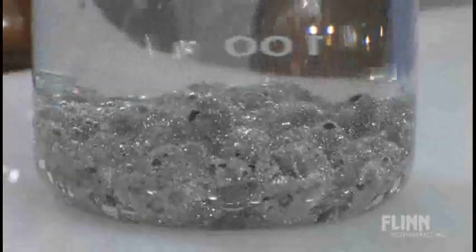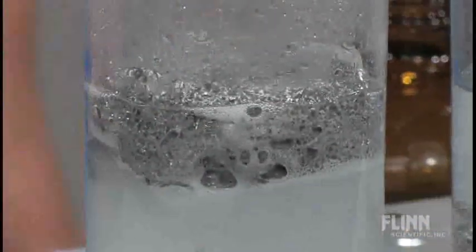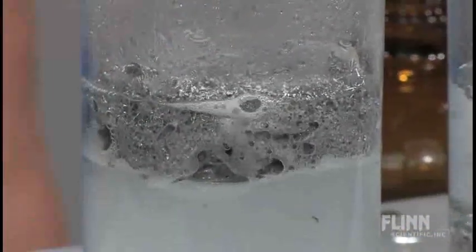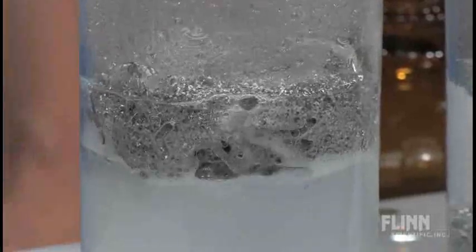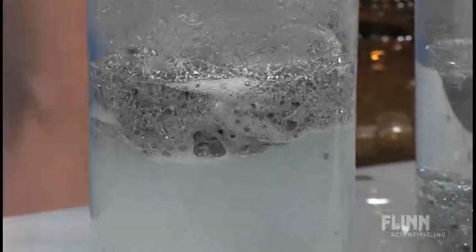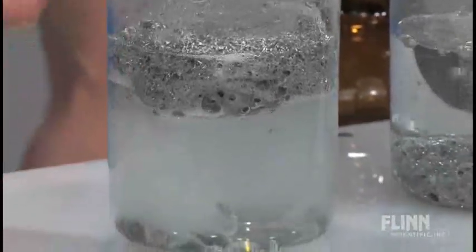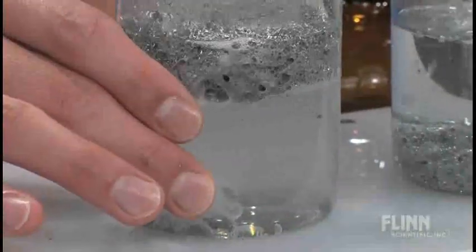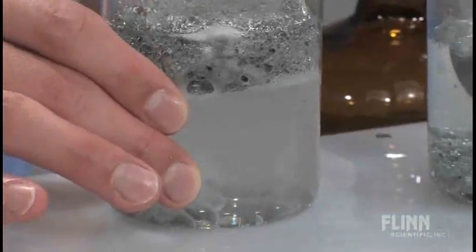You can see that after we've used it for about, this one's gone for I think about 40 minutes, the sponge actually starts to levitate. The hydrogen gas starts being generated on the bottom of that solid mass of tin crystals and it actually takes it and levitates it upward. And I'm going to scoot this back just a little bit so we can see them side by side.